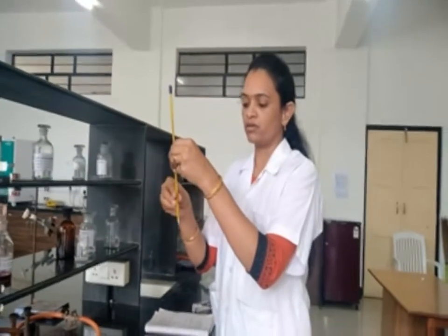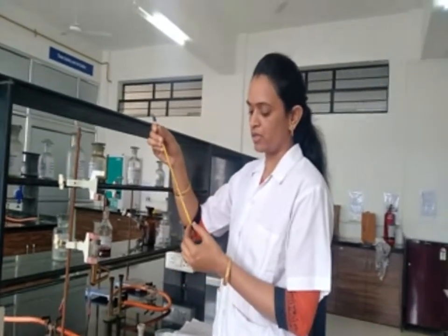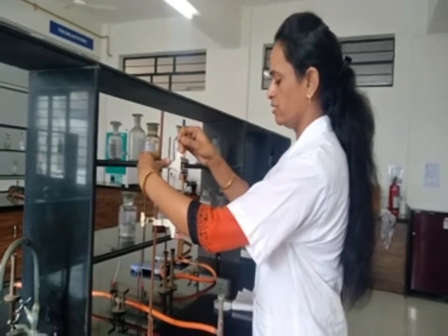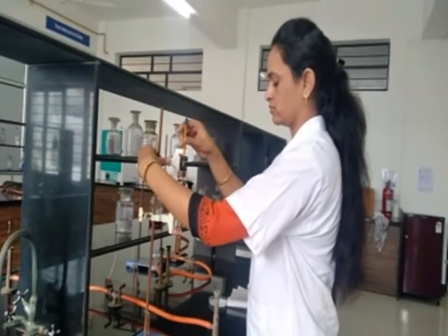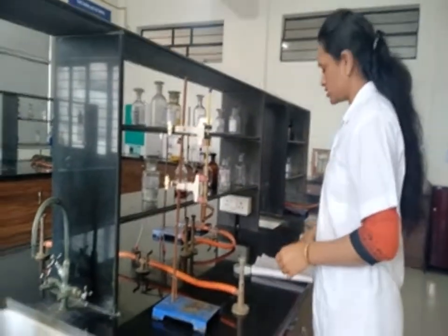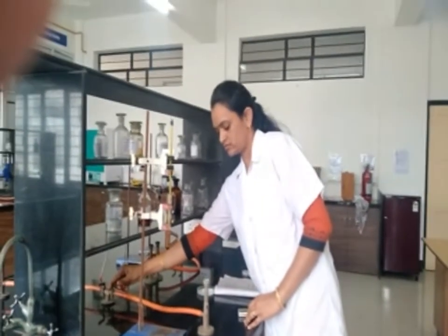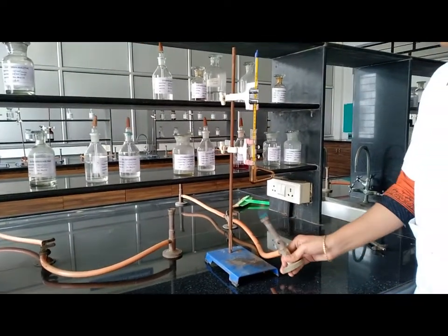Put the thermometer with the attached capillary into the thiele tube containing liquid paraffin. Only 50% of the capillary tube should be immersed into the liquid paraffin. Then start heating on a low level so that even, constant heat is provided to the liquid paraffin.